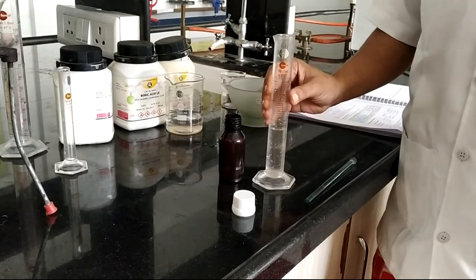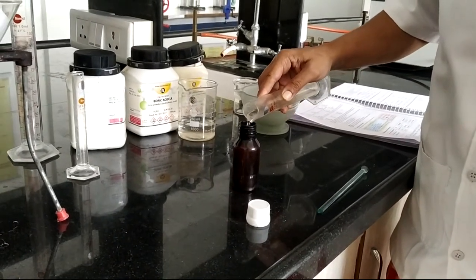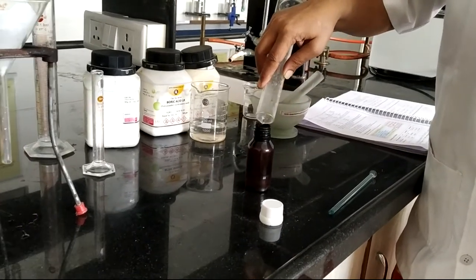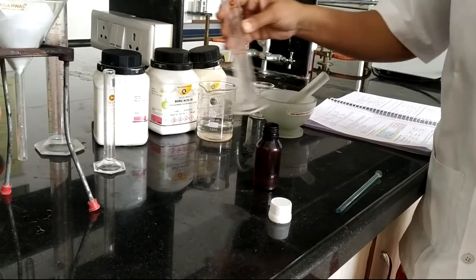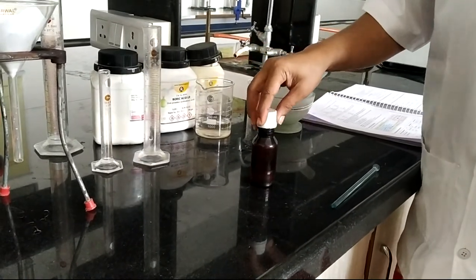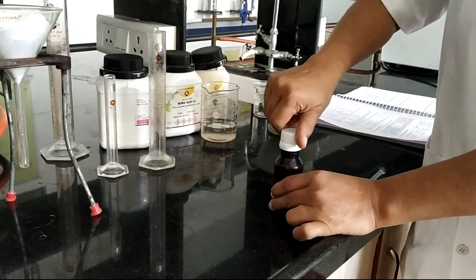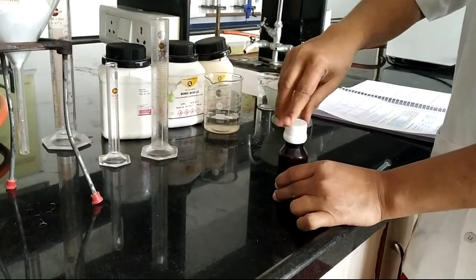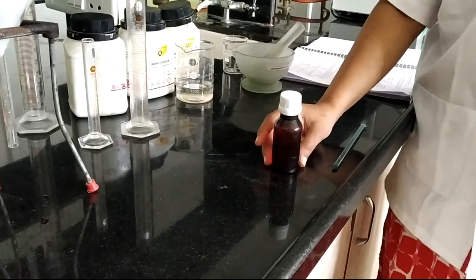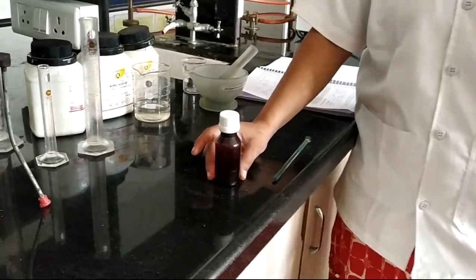Fill the preparation into the final container — an amber-colored bottle. Our preparation is initially alkaline; with the help of boric acid it becomes neutral. It must be submitted in an amber-colored bottle protected from light. Then we move towards the labeling section.